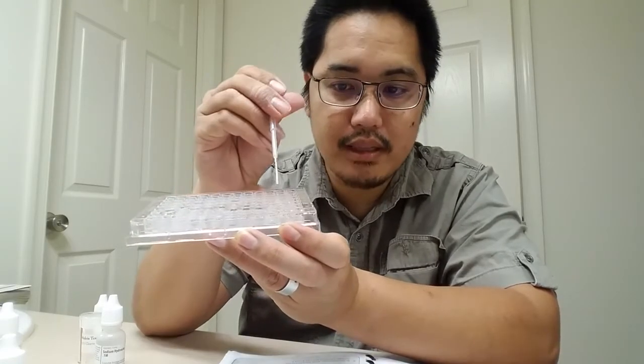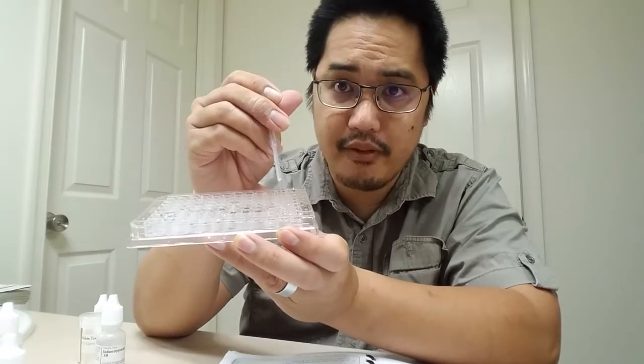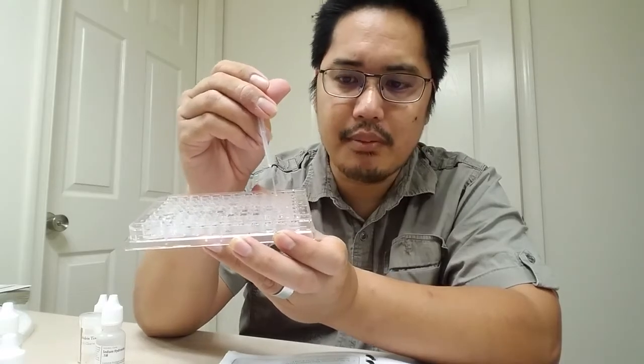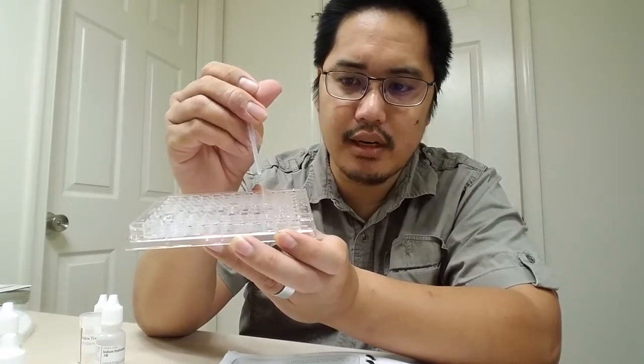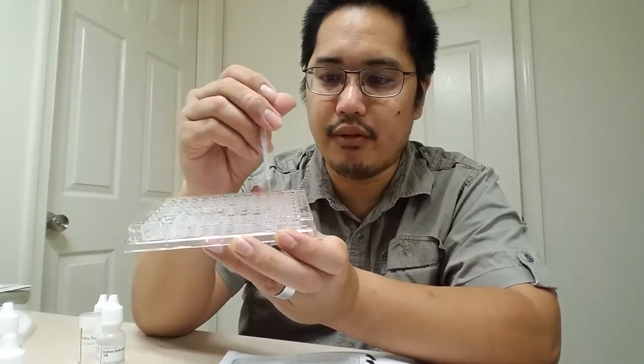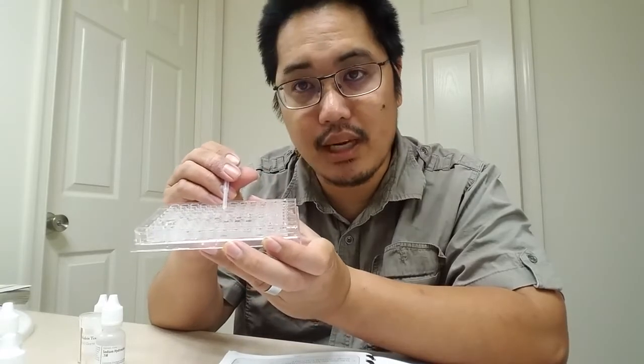All right. Then I repeat that where I'm going to take some from A2. I'm going to put 1 of those drops into A3, and then I'm going to put the rest back into A2. Then I'm going to take my pipette and swish around A3, and then do that for all of them, all the way up to A6. Now, that's going to take a long time, and I just did it for A's. You have to repeat that same process for B, D, E, and F.